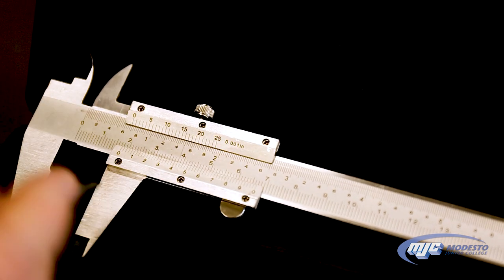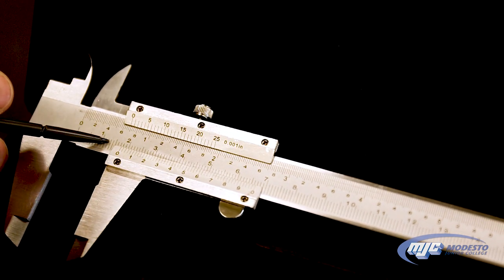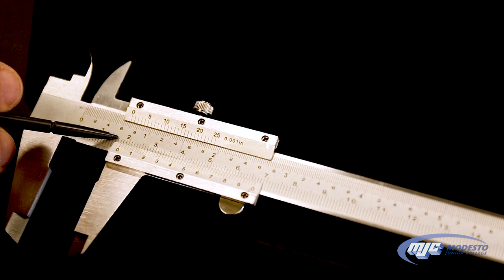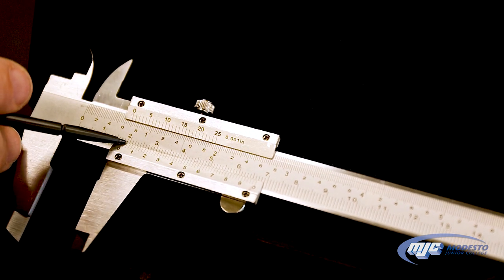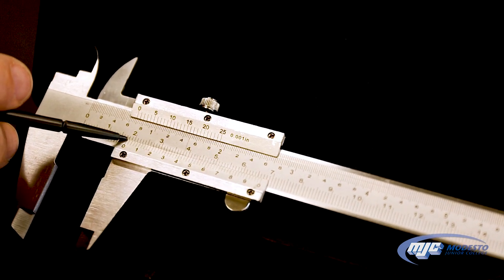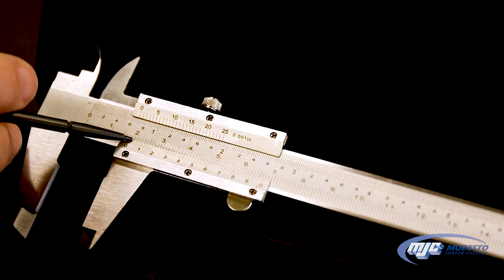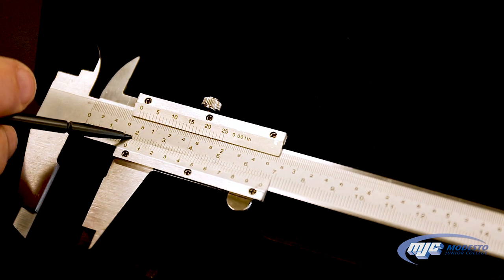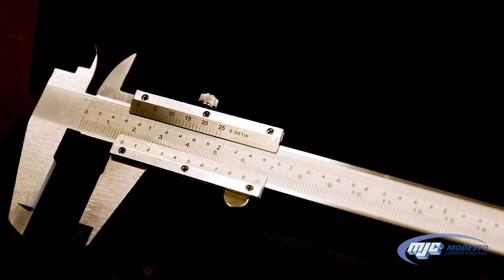So 1.1, 2, 3, 4, 5, 6, 7, 8. So the line is between 1.7 and 1.8 centimeters. So now we have one place past the decimal.